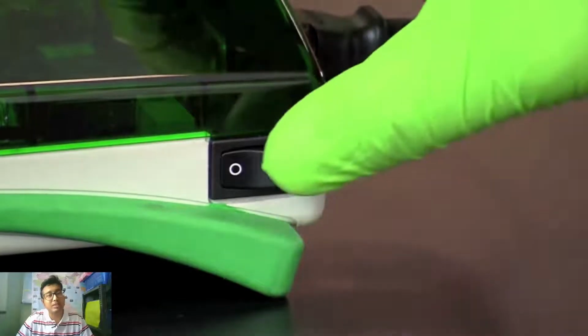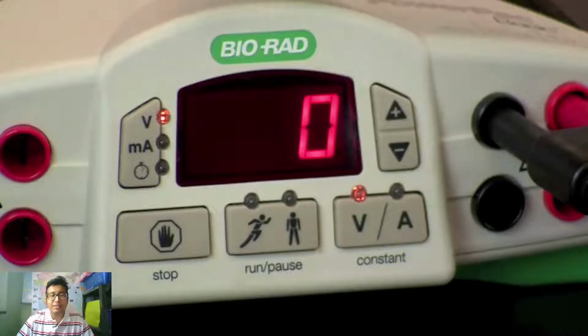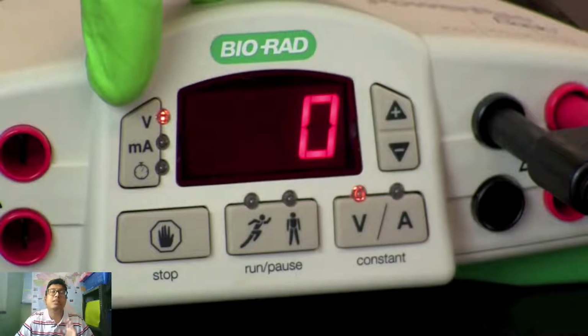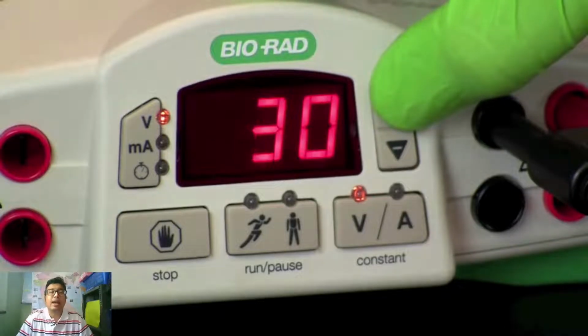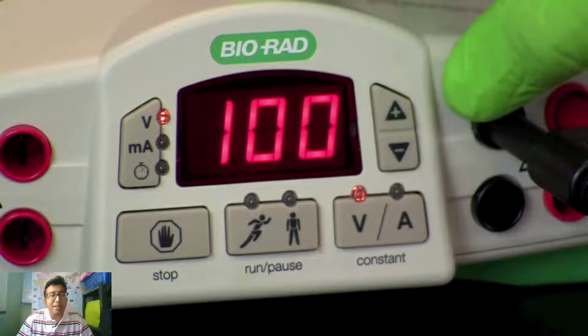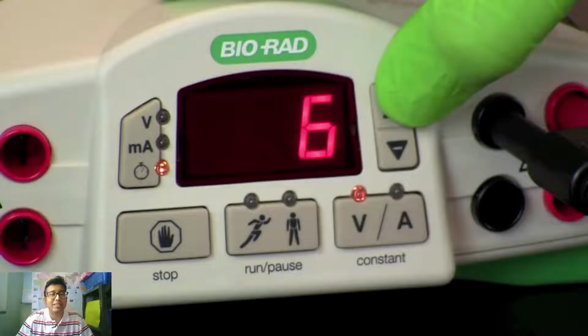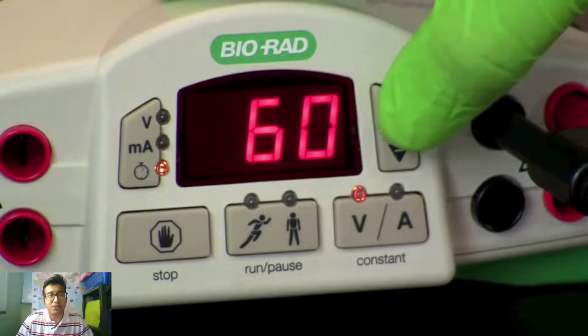After that, we will switch on the power supply and we need to set a constant voltage. You see over here the V is constant, so you can change the mode, either constant current or constant voltage. For DNA gel electrophoresis, we always choose constant voltage, and that also depends on your lab protocol. So constant voltage is first set, and then if the machine supports a timer, a time is also set, depending on the standardized protocol. If there is no timer, we need to stand by manually and see how far the DNA has gone.